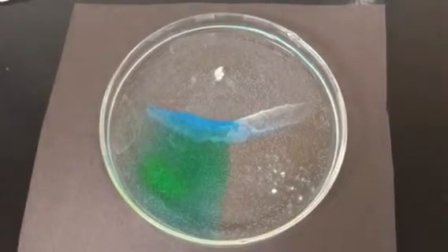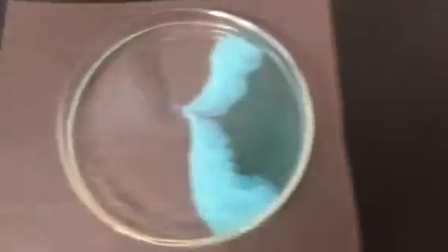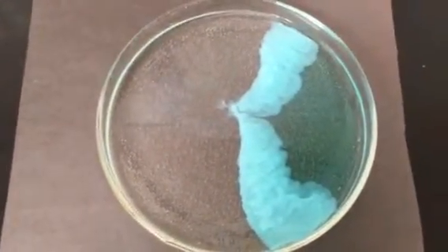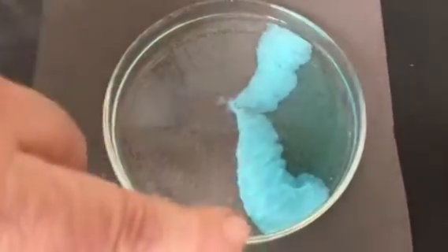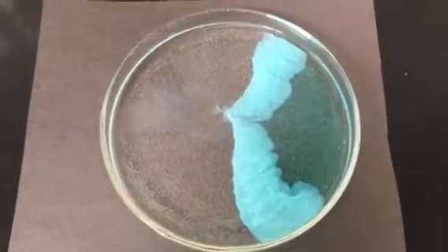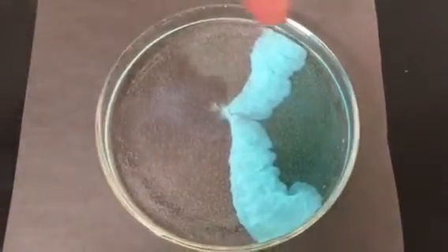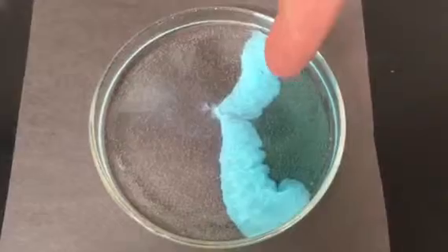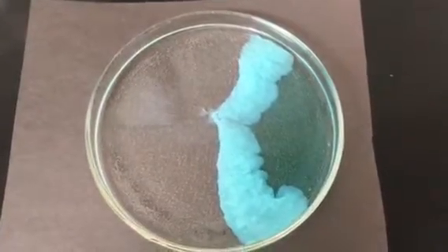I'm going to ask the videographer to come over and look at the previous one so you can see how it has developed and how much it's spread. You can really see the cloudy effect along this line here, and that's what I want you to draw, and I want you to describe it. It's still clear here, and this is green, but it's also clear. But along here it's cloudy, and what does that mean?